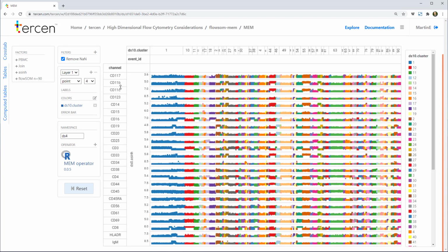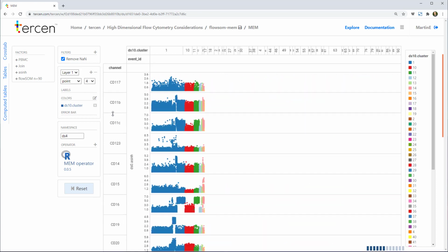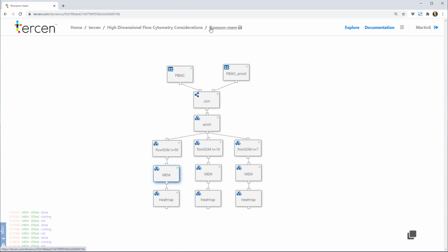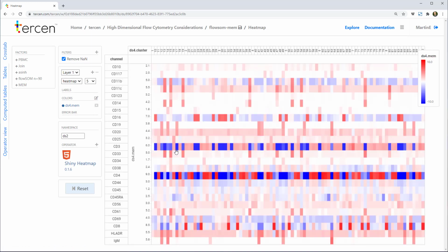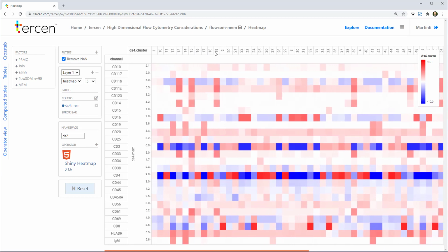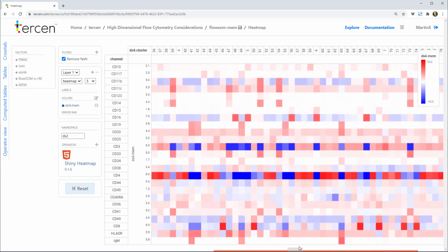By looking closer, we can see that the cells do show differences in either variability or homogeneity inside a marker. We'll apply the MEM operator to score each one and then see which of those 90 clusters have similar profiles across all of the markers. This heat map visualizes the results of the MEM scores. You see the 90 clusters are along the x-axis and the signal markers on the y. Red indicates enrichment and blue indicates depletion of that marker in the cluster. Even at this stage, we can spot clusters with marker enrichment profiles that are similar to each other. For example, see clusters 19, 39 and 73.